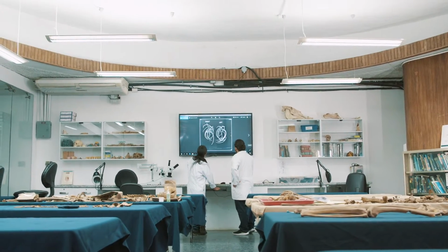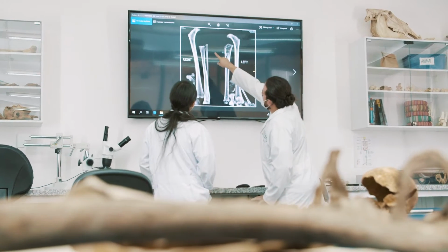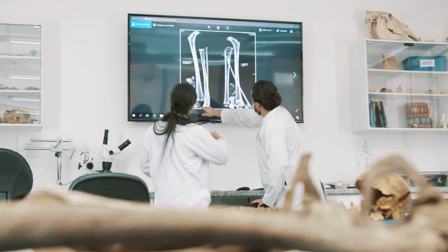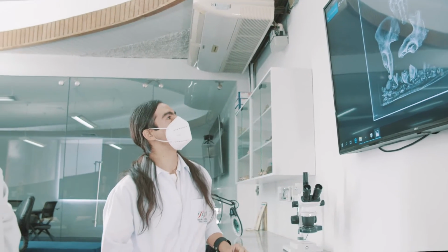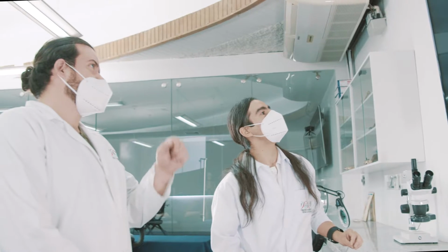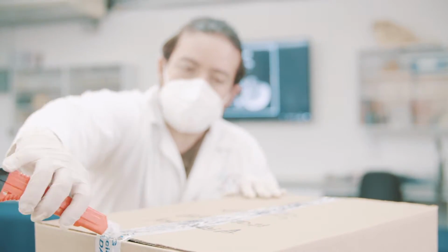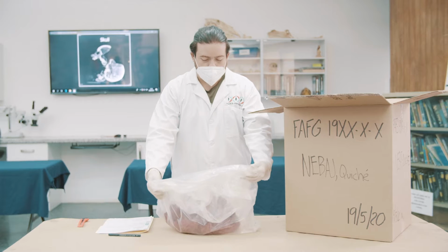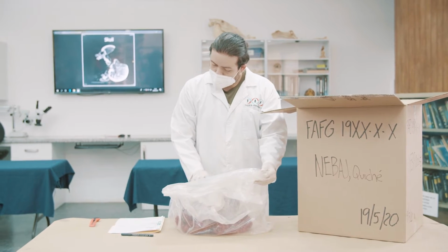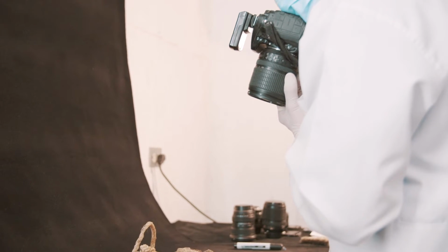The next step is a review of the X-rays from the case to be analyzed in order to have a broader understanding of the remains to be washed and reviewed prior to the washing stage. Any peculiarities, such as the presence of radiopaque objects or signs of violence, are recorded. The box of remains will then be opened for examination with the help of the exhumation file. If any relevant findings are observed before washing, it is necessary to take a pre-wash photo in the photo studio.